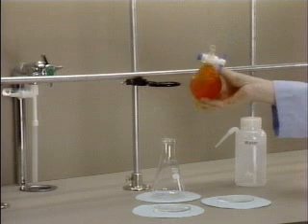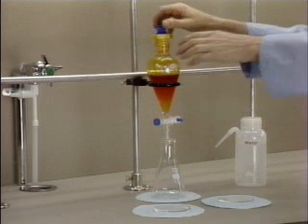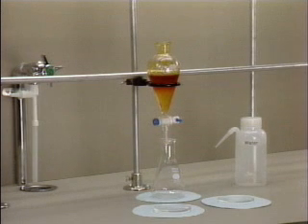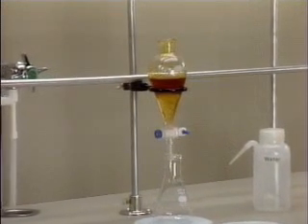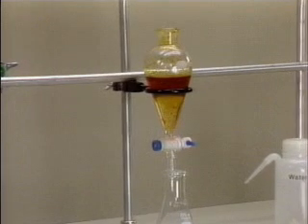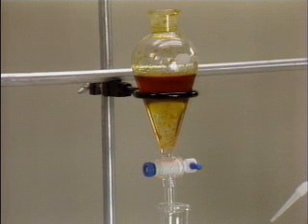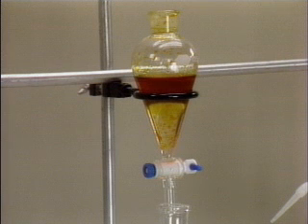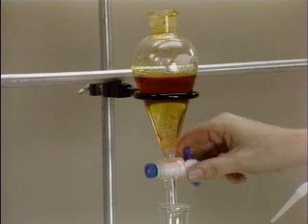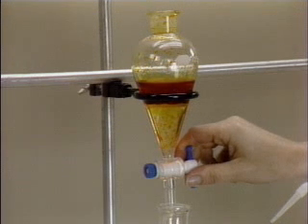However, if a large amount of material is transferred from one phase to the other during an extraction, the relative densities of the original phases may change. That is, the phase initially at the bottom of the separatory funnel is on top after the extraction. Therefore, it is essential to know which phase is which before either is discarded. If the volumes of the two phases are substantially different, then one can distinguish and identify the phases. However, because of the shape of the separatory funnel, the lower layer may appear to be larger than it actually is, and the apparent volumes may be deceptive.